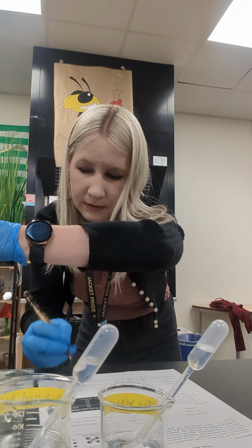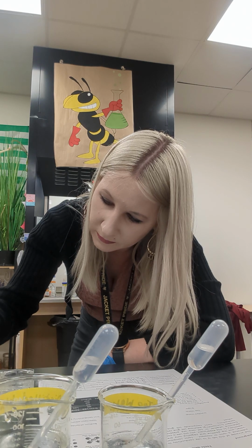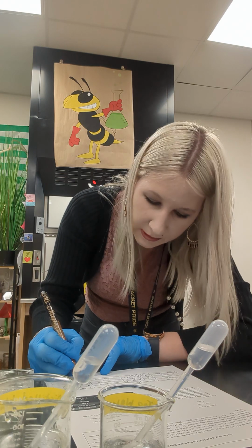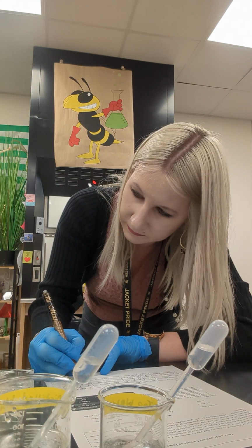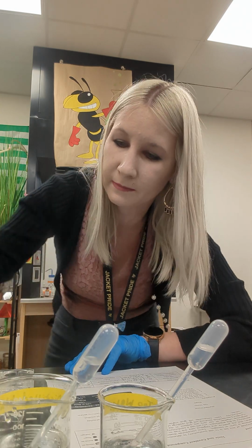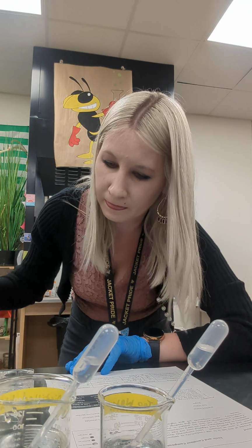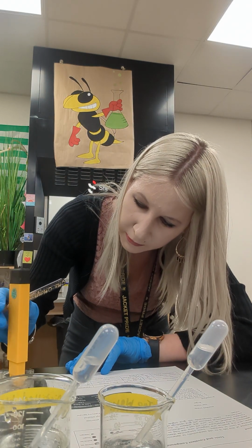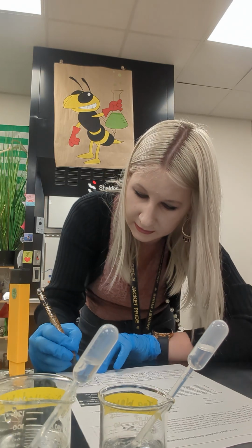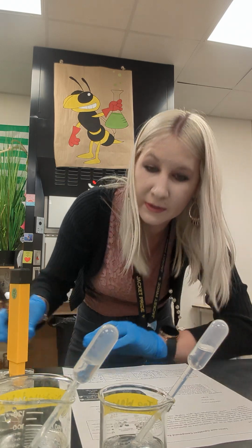And alcohol. Also expecting something low. Not as low. We're in the 800s. 840. I'm going to verify my copper sulfate. Oh, I tested the wrong one. So that was copper sulfate. That makes more sense. Alcohol is also 0 microsiemens per centimeter. Always double check in the lab.